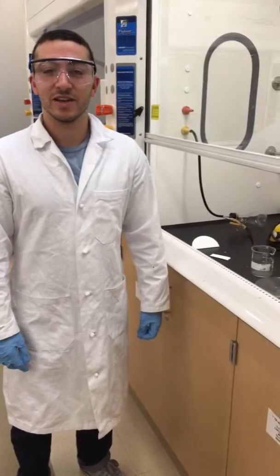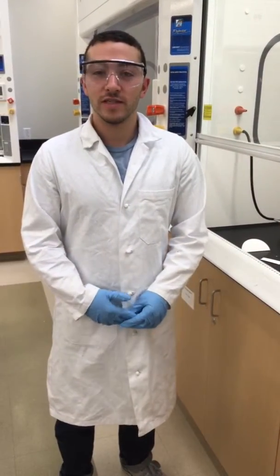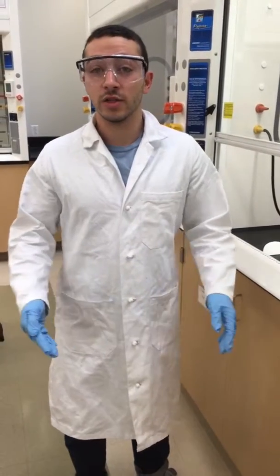And today we're going to be talking about TLC, which is a common lab technique that can help you identify what compounds are in a mixture by separating them based on polarity.